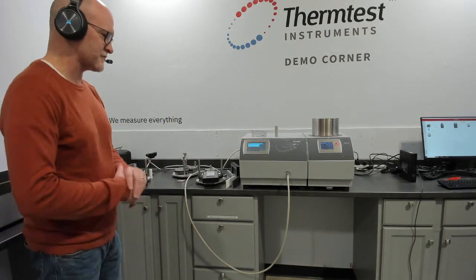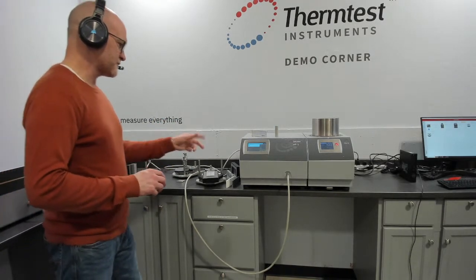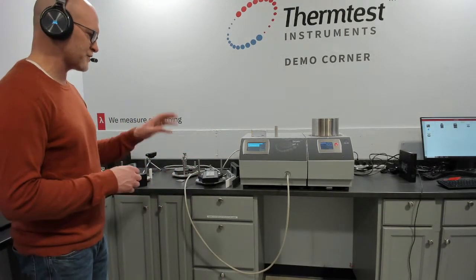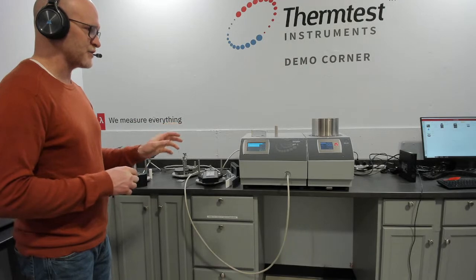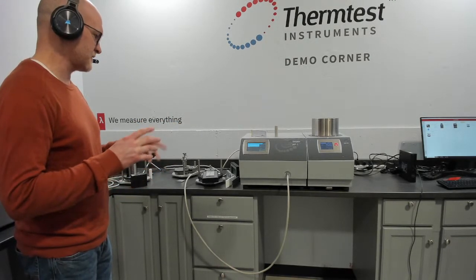So we have the highest frequency related collection of points so that our data is super stable. This method measures the contact resistance between the sensor and sample. Those are all proprietary capabilities of the MP-1, and the Transient Plane Source method on the MP-1. And we'll share a little bit about those.